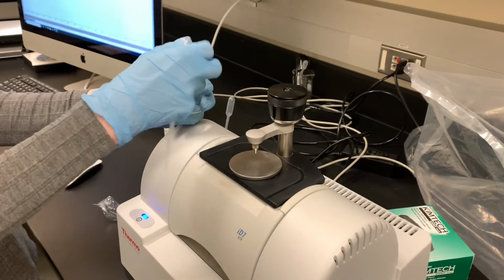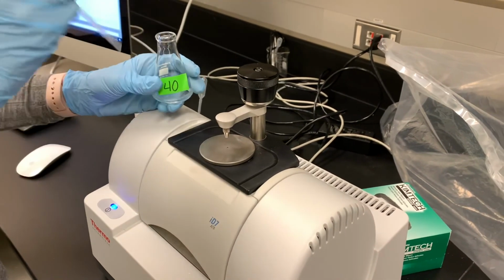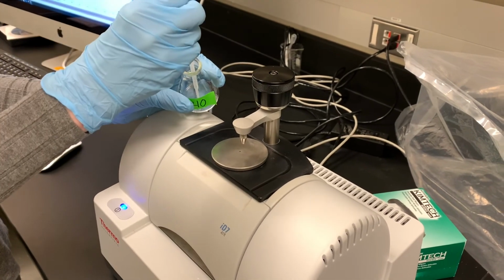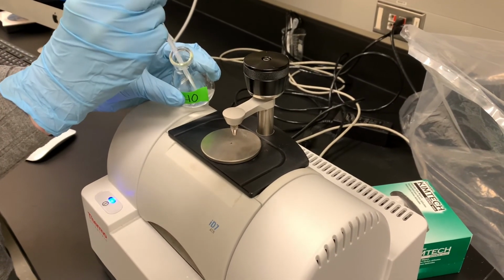This is the product from the oxidation of our insect repellent. It originally had ether in it, and I had it covered with some holes poked in that plastic for the ether to evaporate. So the ether's evaporated, and what we're going to do now is take a little sample of this and measure its IR. It literally just blew itself out of that pipette.